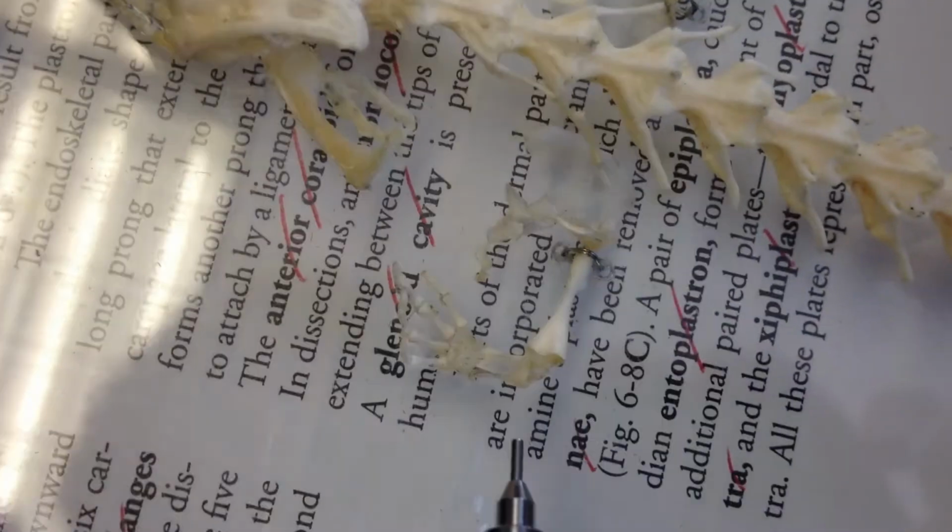on Lab 3, Part 4 of the Necturus, the appendicular skeleton, on page 99, if you want to refer to it. Technically, the pictures are much better than this, but the main point of all of this, the take-home message, is that even the Necturus limb follows the same basic tetrapod pattern.